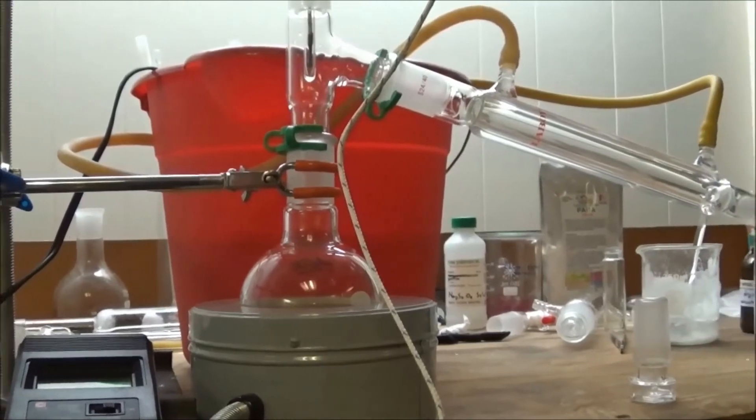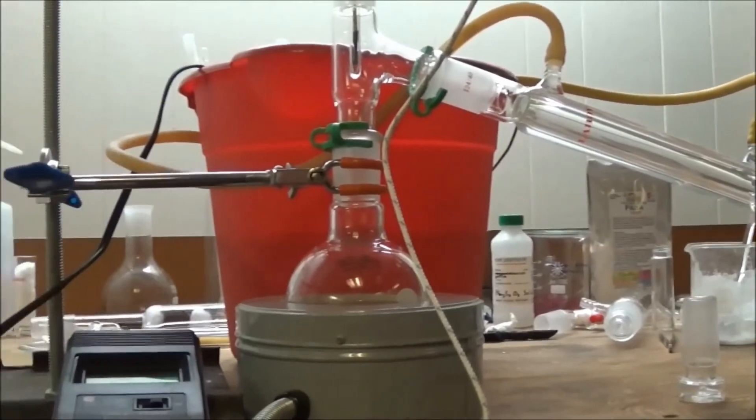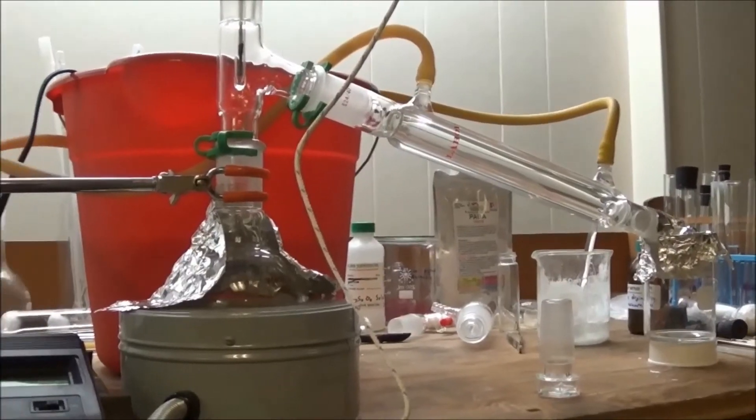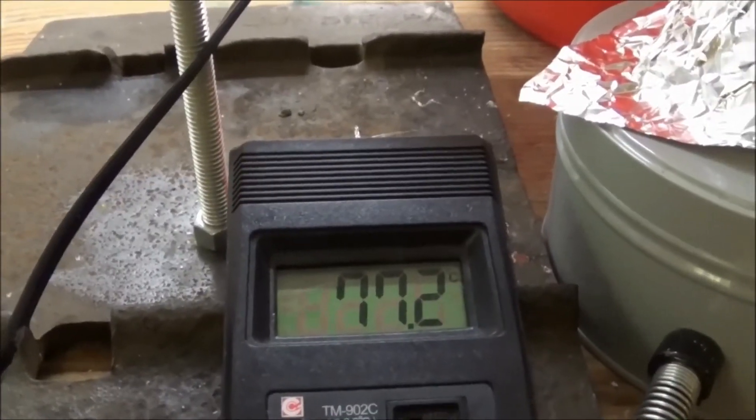I then set up for simple distillation and distilled off the excess ethanol. I recovered about 110 milliliters of ethanol before calling it good and stopping the distillation.